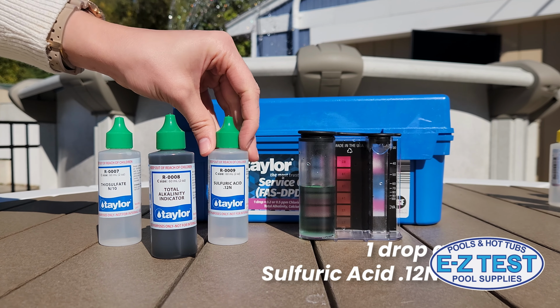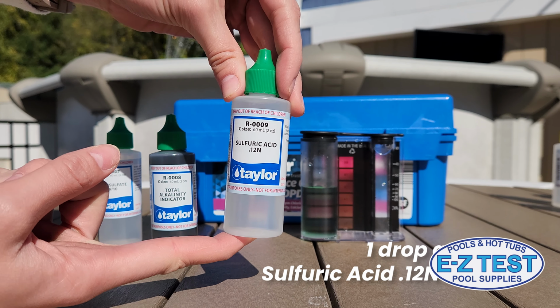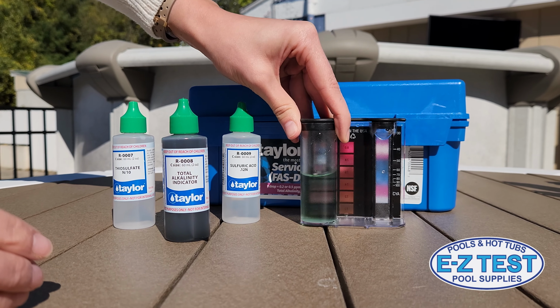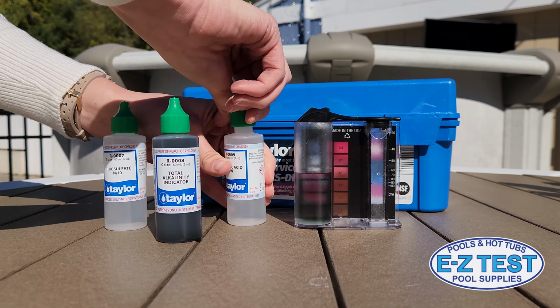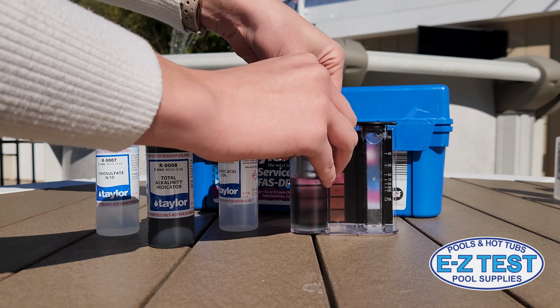Now, using R0009 sulfuric acid titrating reagent, add 1 drop at a time, swirling after each drop. Count the drops until the color changes from green to red. That's your endpoint. In our example, it took 10 drops.